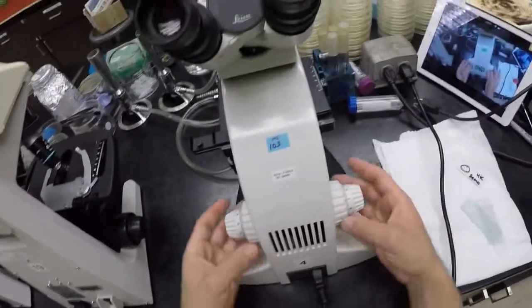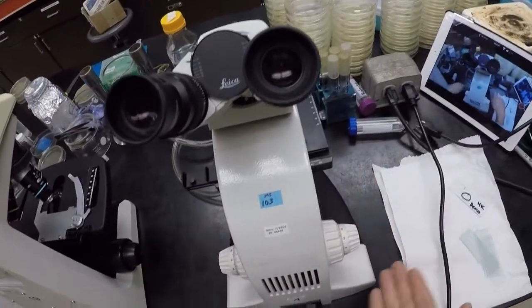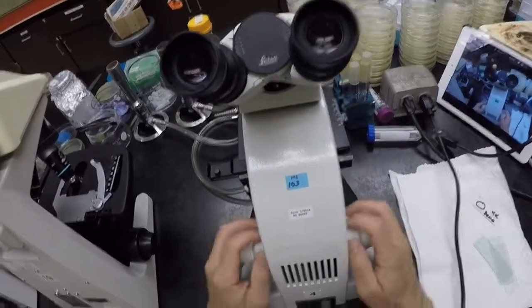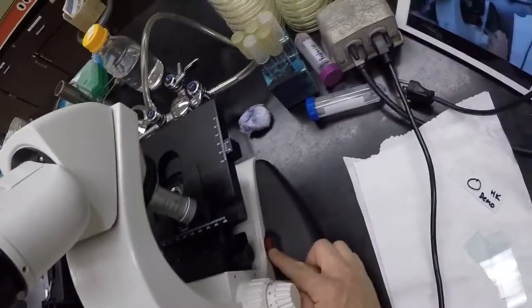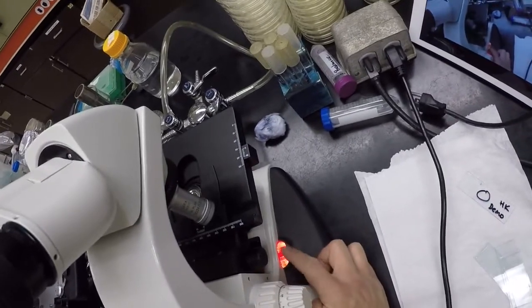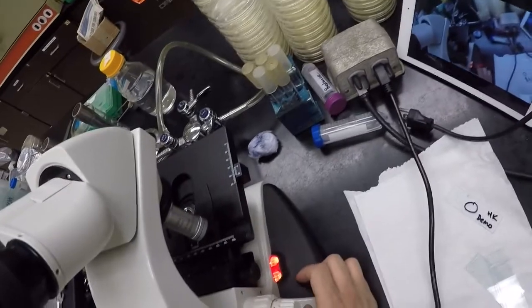And the reason I like the spine facing you is that turning away brings the stage down, rolling towards you brings the stage up. So it's a very intuitive roll, right? That's why I like spine towards you, very easy. That's down, this is up. Good. And finally, our light switch, right? So here's our light switch. Simply click that forward, that turns the light on, and then forward all the way, that's brighter, and then closer to you, and that's less bright.